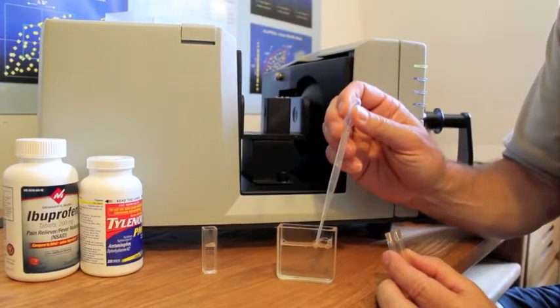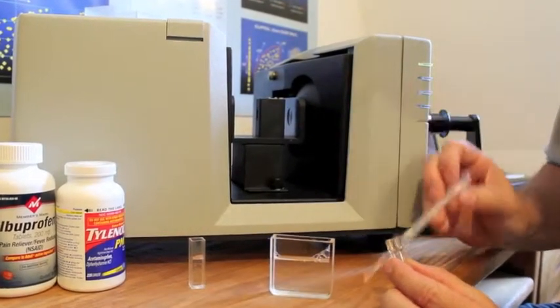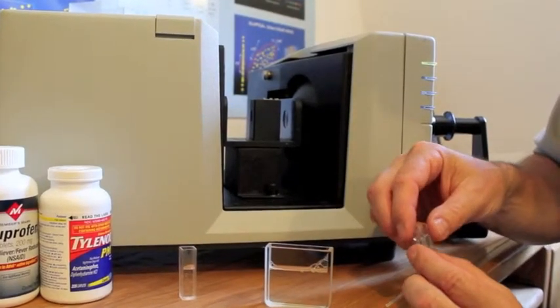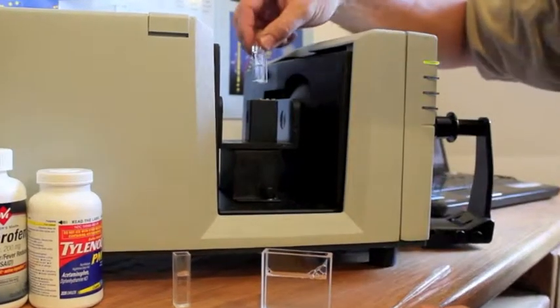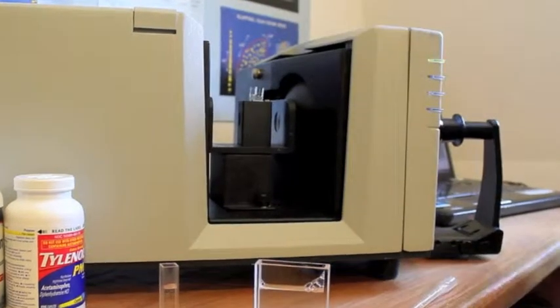Now I'll begin my process of taking a measurement. Fill the cell, which could be less than one milliliter of liquid, place it in my holder, and simply take a reading.